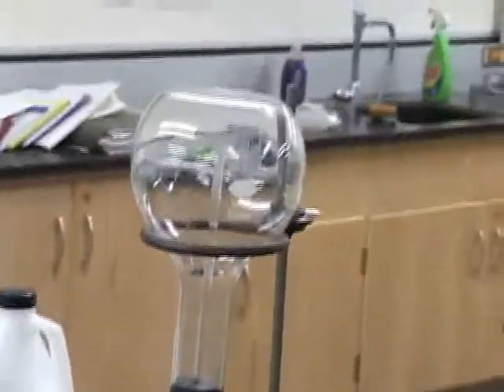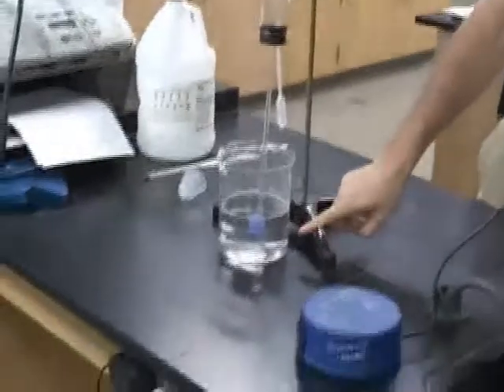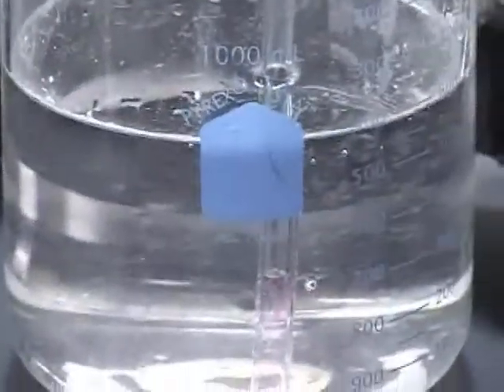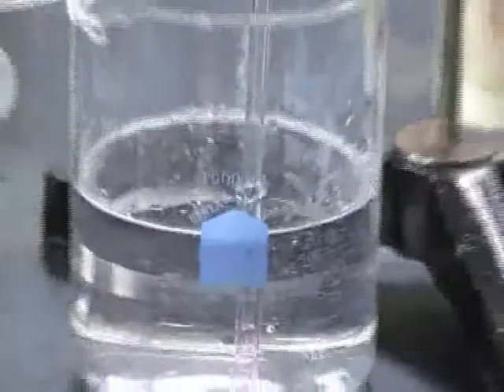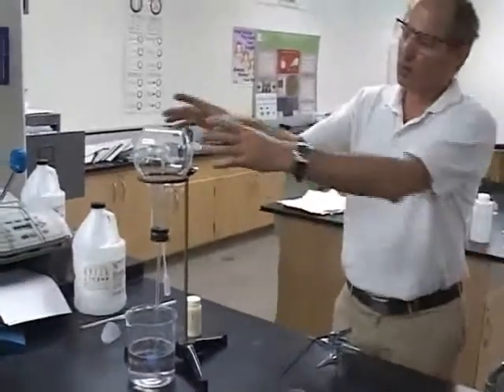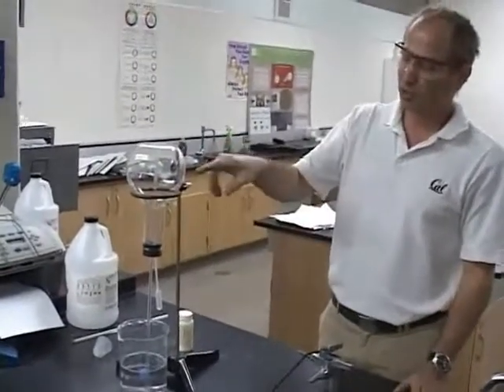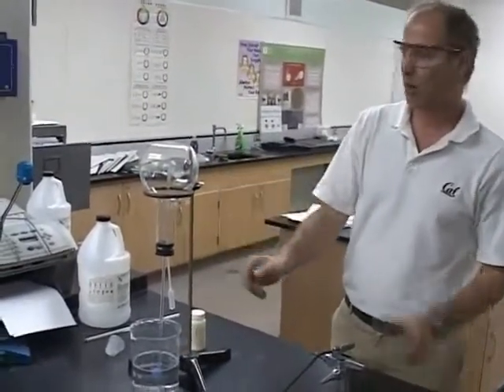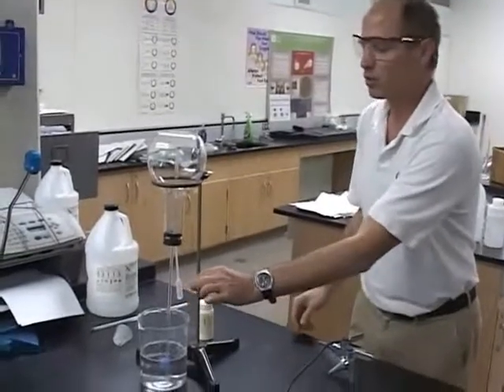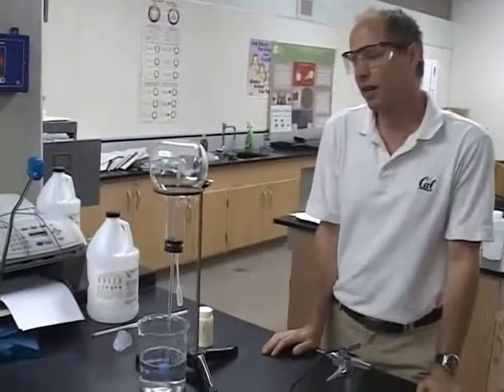What color does phenolphthalein indicator turn in the presence of a base? Pink. Do you notice any slight pinkness down there? Yeah. So what gas was inside this flask? Ammonia. Now, if you had ammonia gas in here, and ammonia gas is extremely soluble in water, what would happen if I squirt some water in the bottom? What would happen to the ammonia gas in the air?